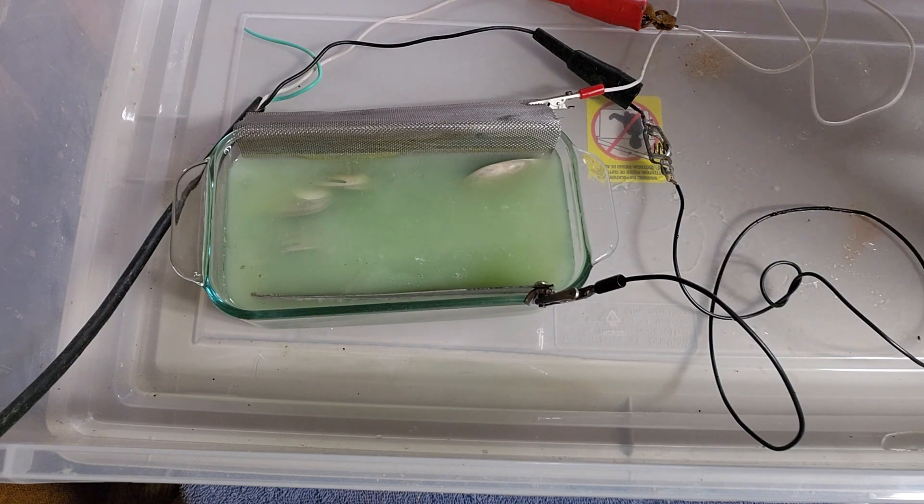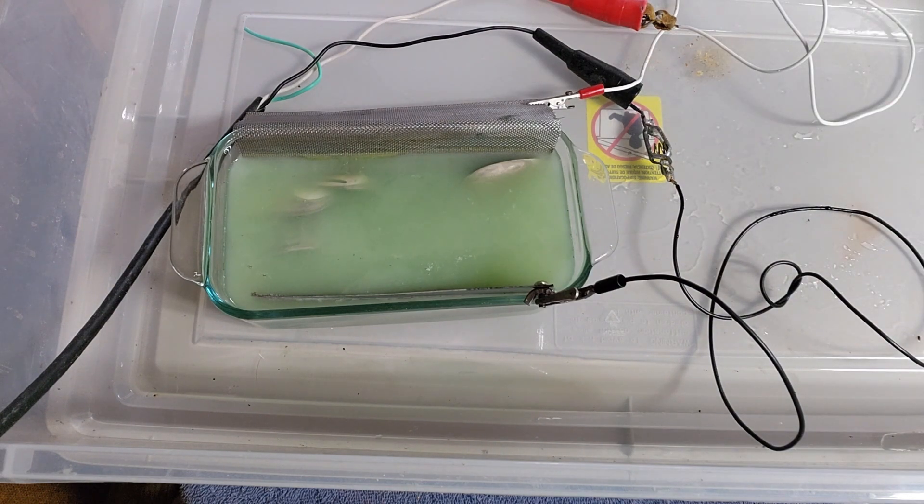Starting to see some flakes popping off my cathode. I've got enough electroplating experience to know there is absolutely no condition in this tank that is going to allow for the successful electroplating or electro-deposition of silver on that cathode - it's not going to happen. You're going to watch and see what does happen, because it actually gets a little gnarly. If you're a refiner looking at this you'd say that's bad, but I'm saying no - that's good.